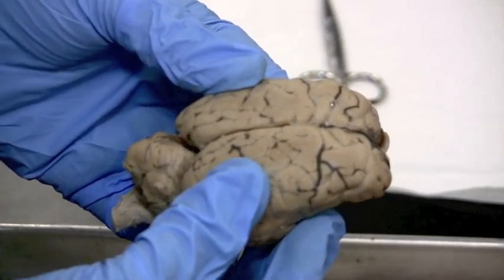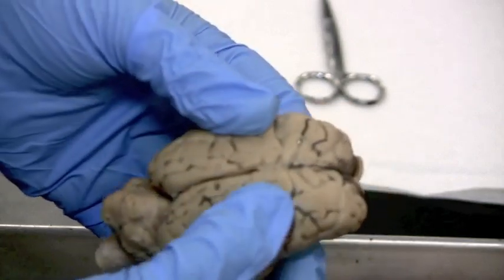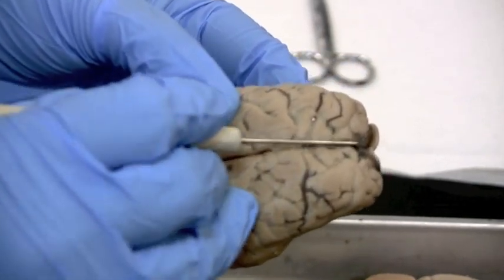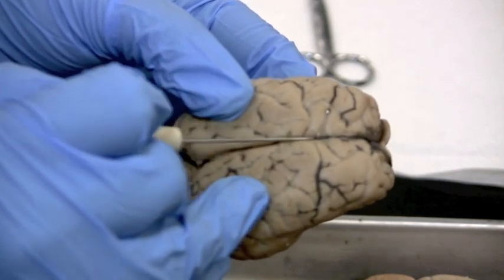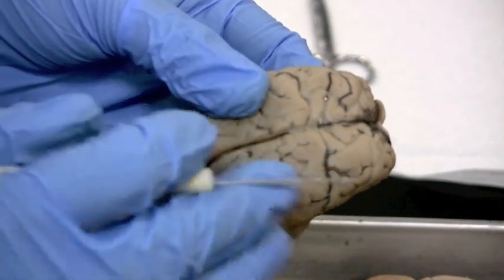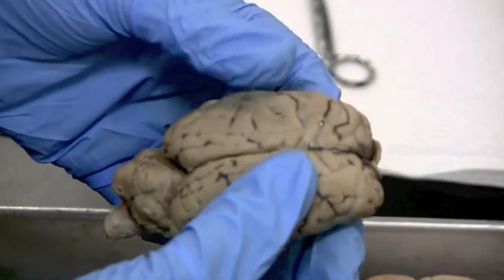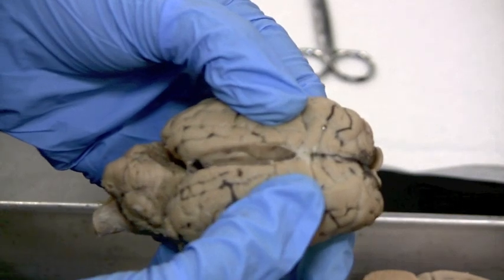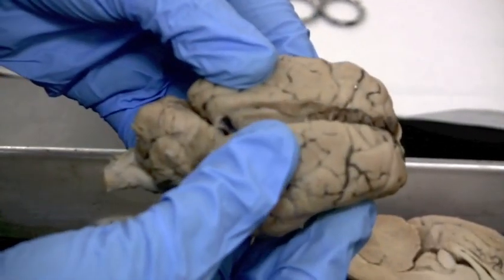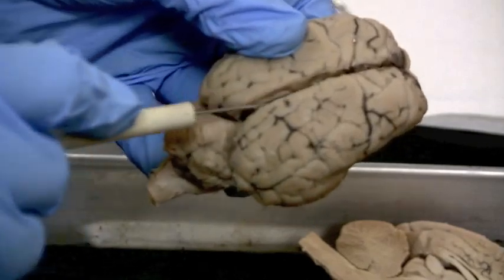When we make our midsagittal cut down the center, this brain is already starting to separate at the cerebral hemispheres. There's membranous material here — that's the arachnoid mater and pia mater left over from the meningeal layers still close to the brain. The dura mater is no longer on this brain; it would be like a hard, durable swimming cap over the top, but it's been removed. Teasing those layers apart, there's no real connection between the hemispheres until you reach the corpus callosum in the middle, which is where we'll have to cut through.